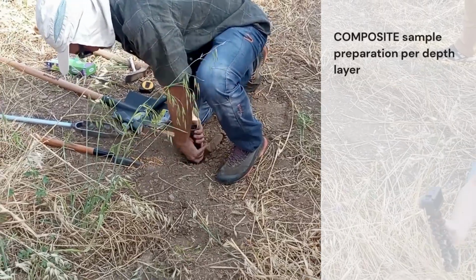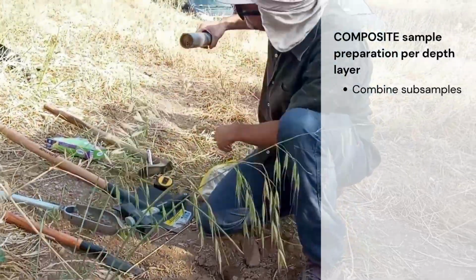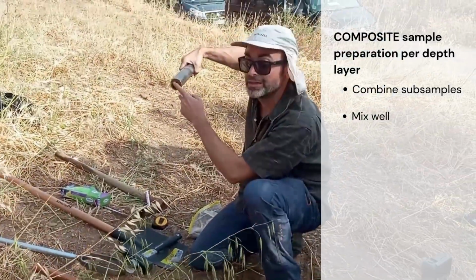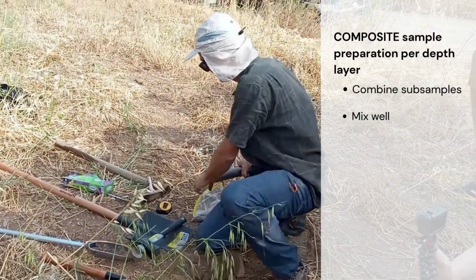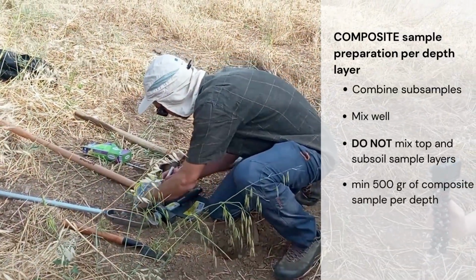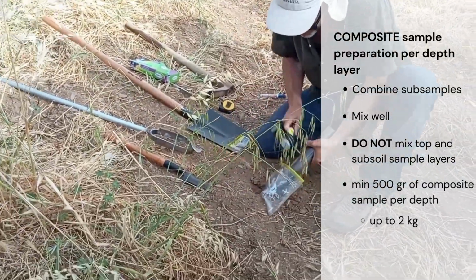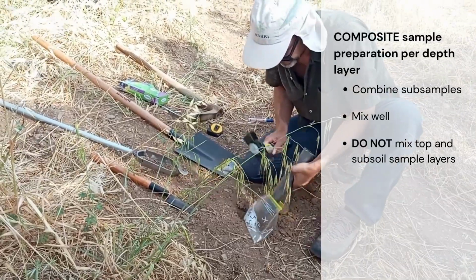For each depth layer, combine the 4 subsamples from the sublocations into the bucket or heavy-duty bag, and mix thoroughly to form one composite sample per depth. Do not mix topsoil and subsoil. Target at least 500 grams of composite soil per depth. Collect up to 2 kilograms if several laboratory analyses are planned.